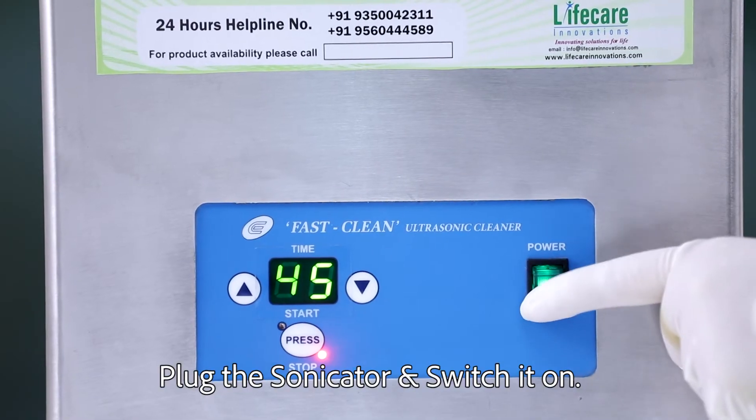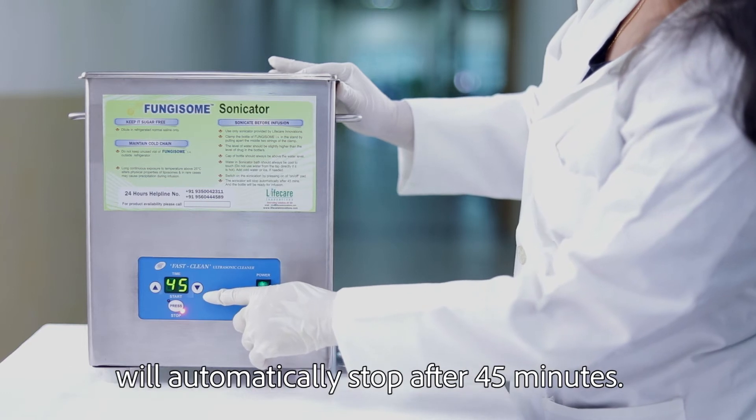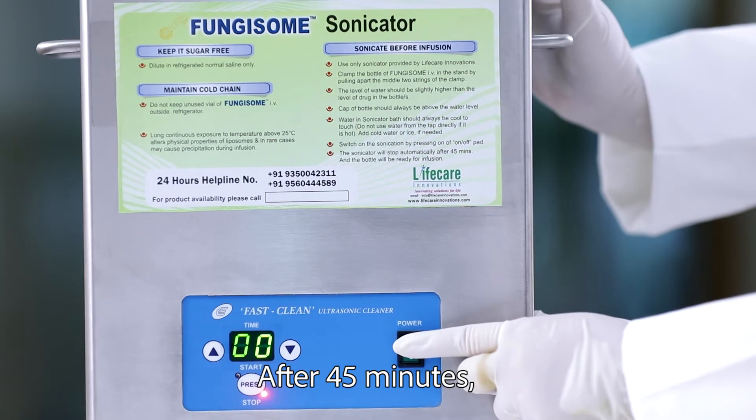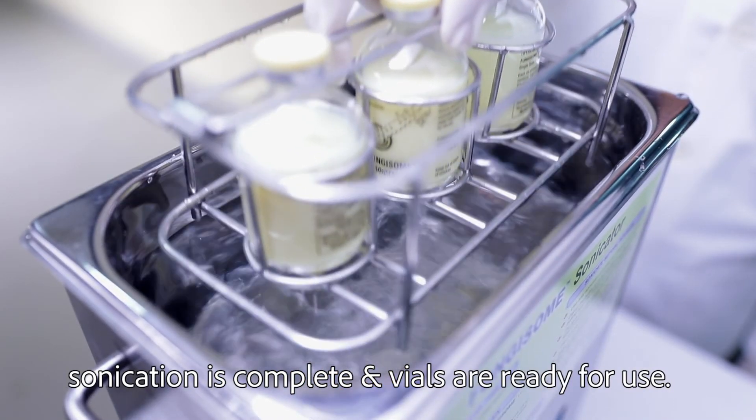Plug in the Sonicator and switch it on. The digital screen will show the time, and the Sonicator will automatically stop after 45 minutes. After 45 minutes, sonication is complete and vials are ready for use.